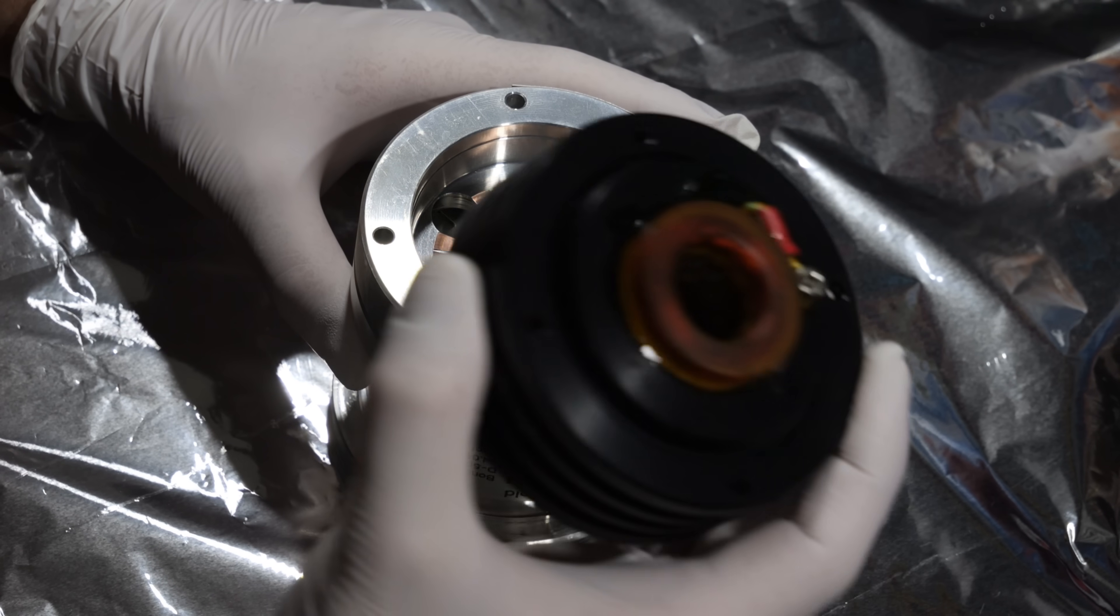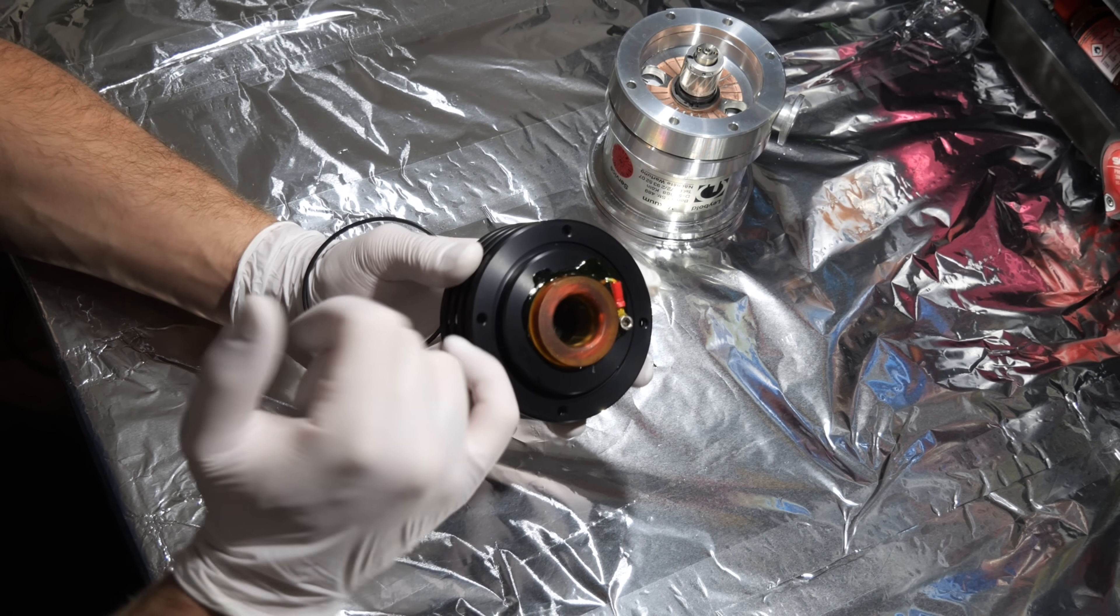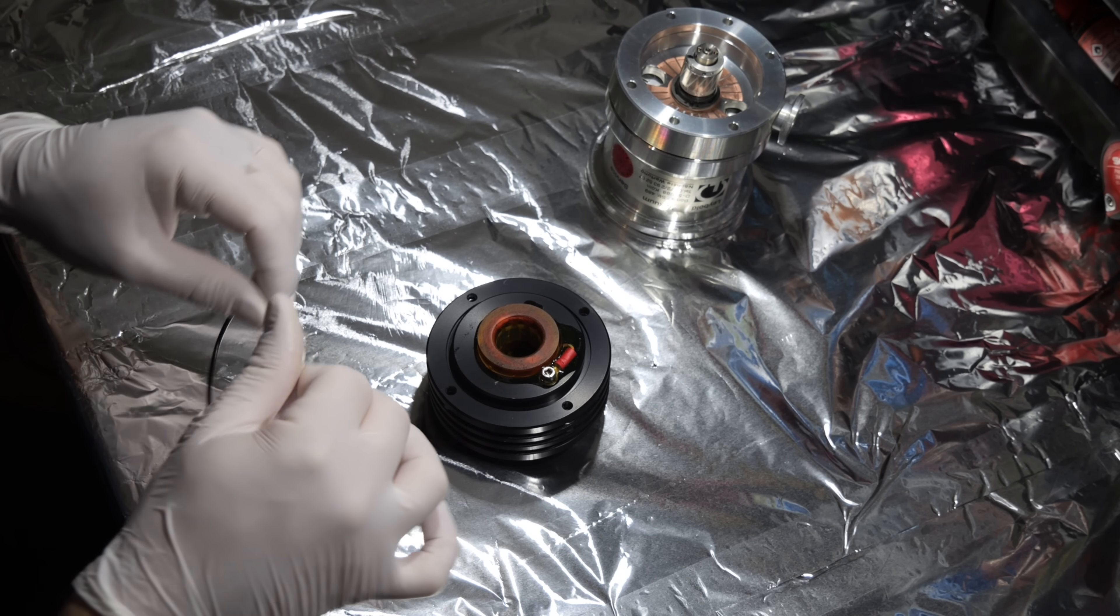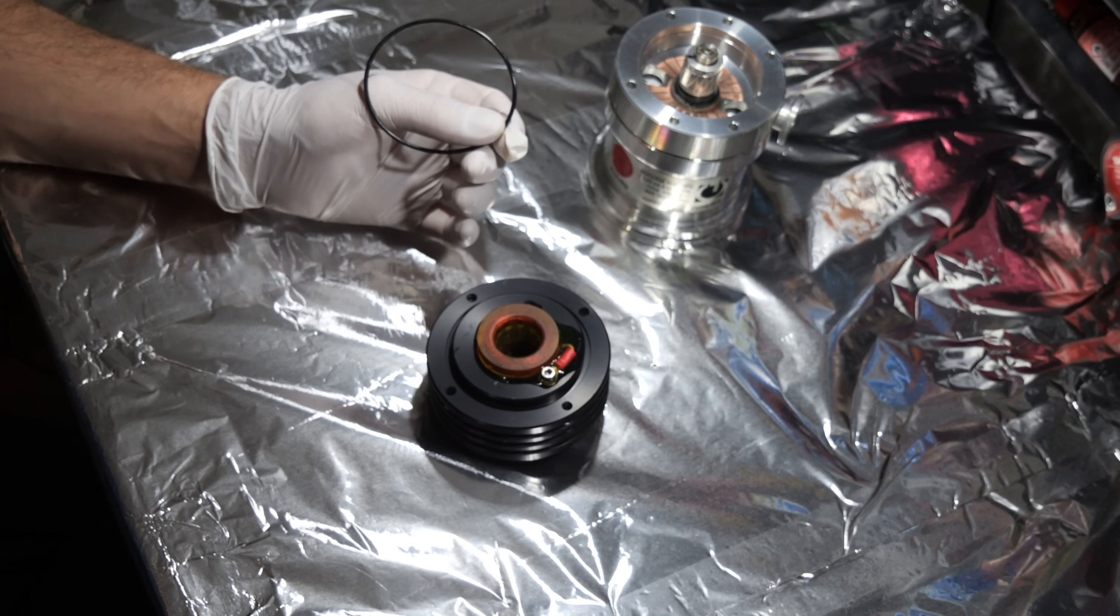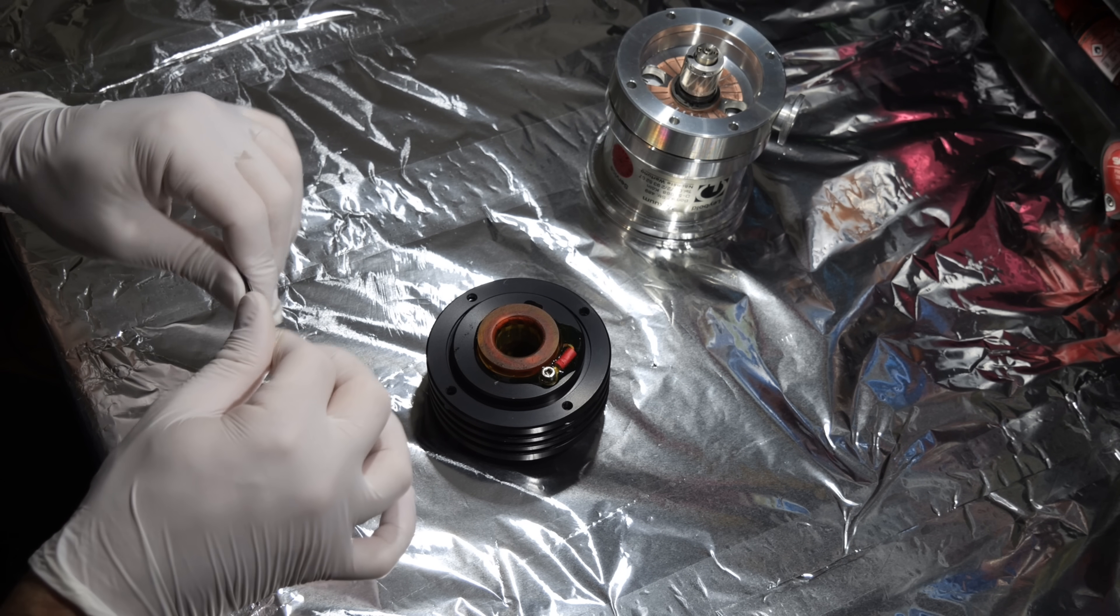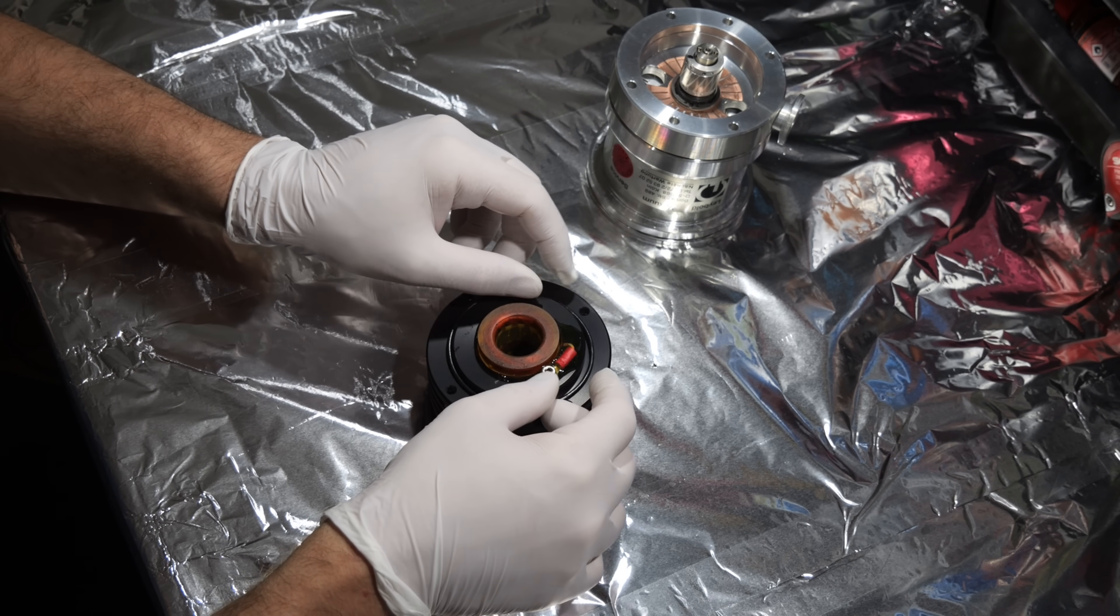Okay, great. Now we can put in the bottom part. The bottom part right here also has an o-ring which sits in this groove here. All the grease I'm using is this Apiezon ultra high vacuum grease. Because all the o-rings are on the low vacuum side or the roughing side. So it shouldn't hurt.